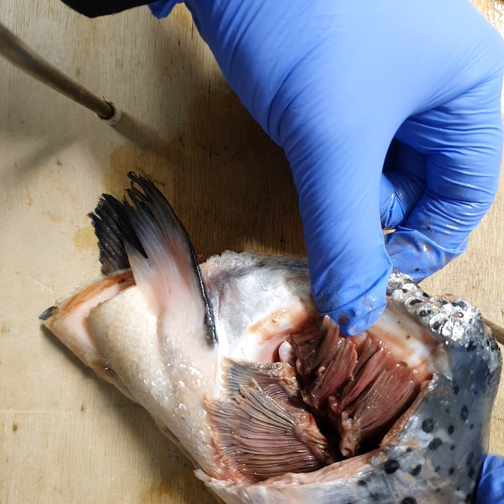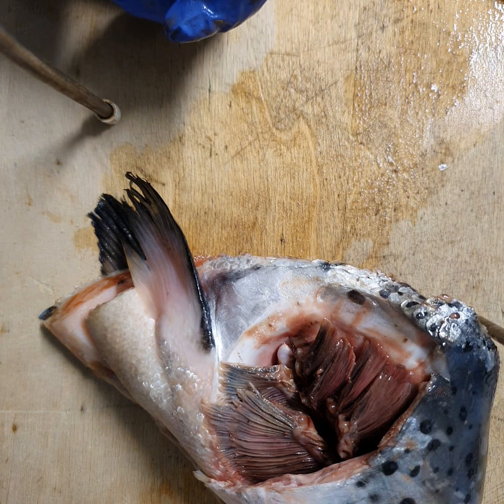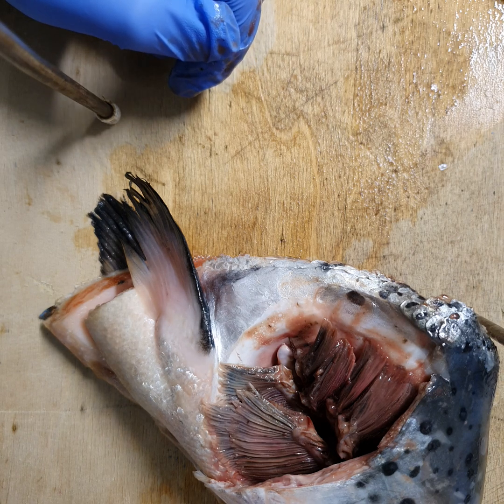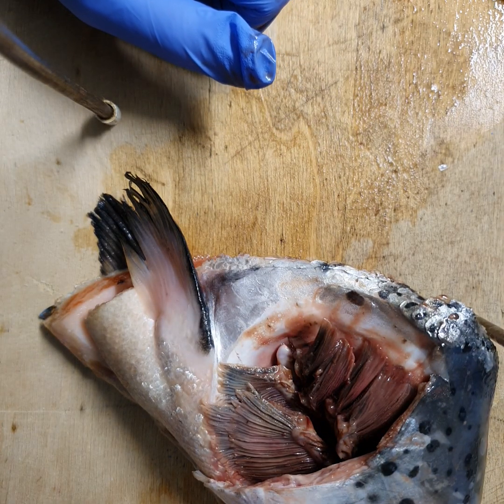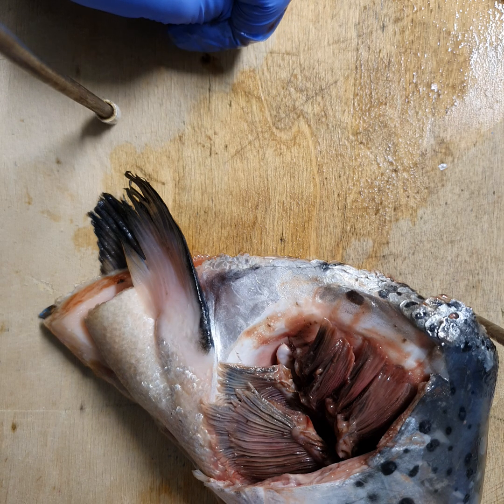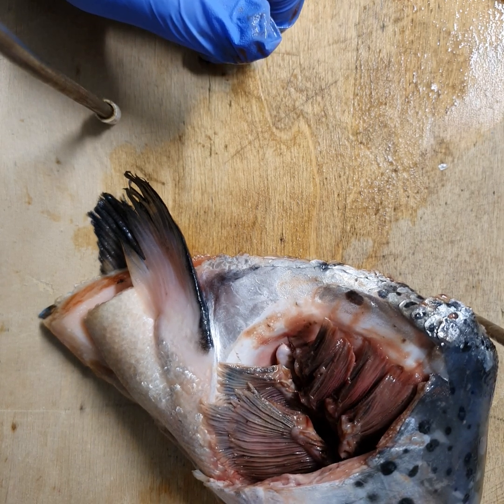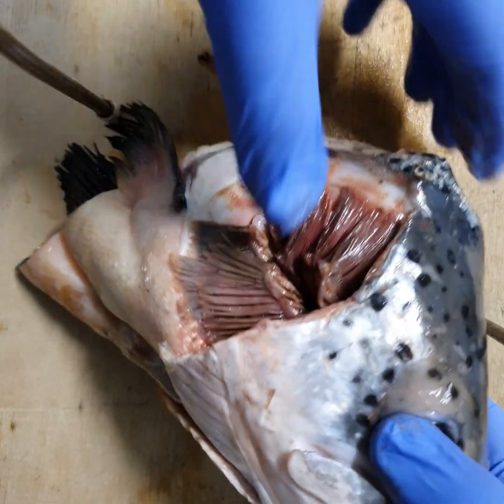A further adaptation in bony fish such as salmon is that the blood runs in the opposite direction to water — that is an example of the counter-current exchange system. Cartilaginous fish have a parallel system where blood moves in the same direction as the water. Fish using that parallel system only take up about 50% of the oxygen available in the water, whereas bony fish with the counter-current exchange system take up about 80%, making it much more efficient.